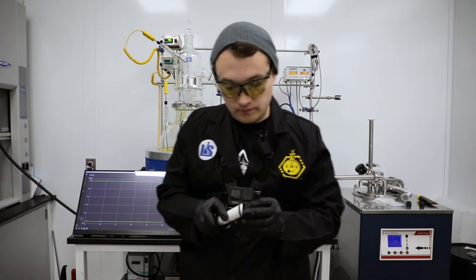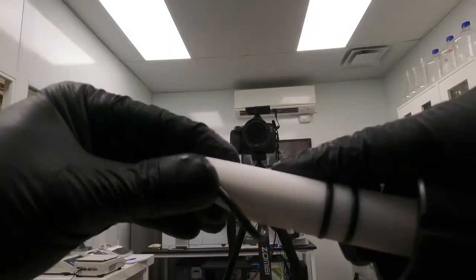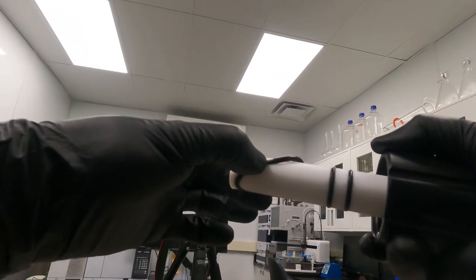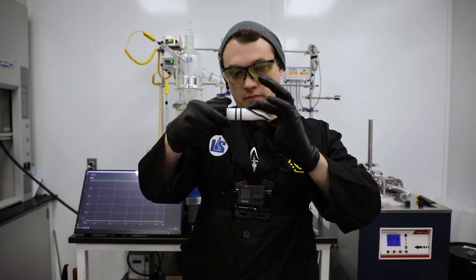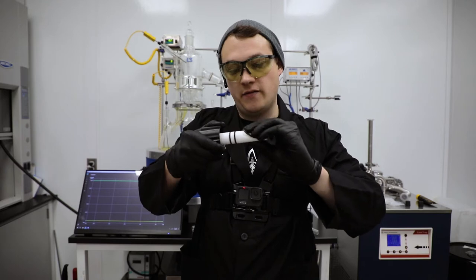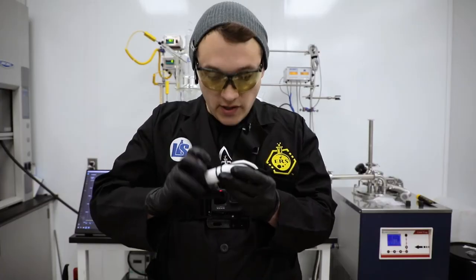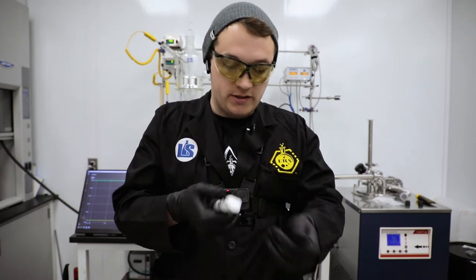Now we'll do the second one. I'm going to press it into the front end here. Now that I've got it about halfway inserted into the trough, I'm going to push this forward and then slide my finger around. It's very important that you make sure the o-ring is fully seated before reassembling this into your system.